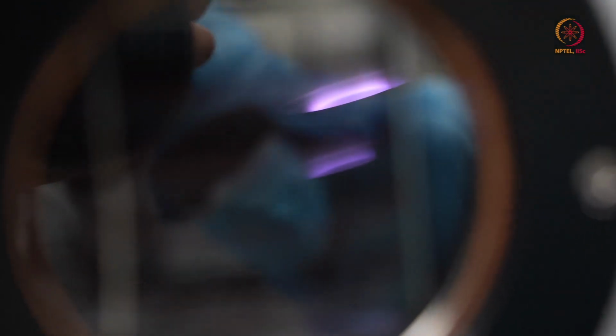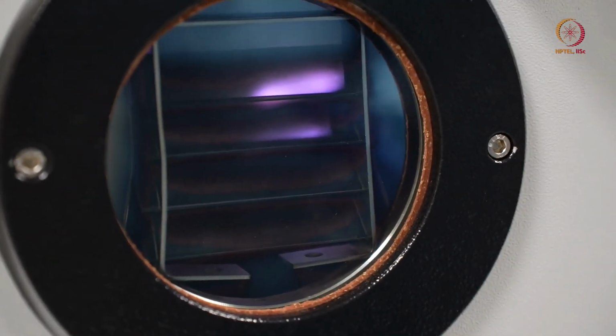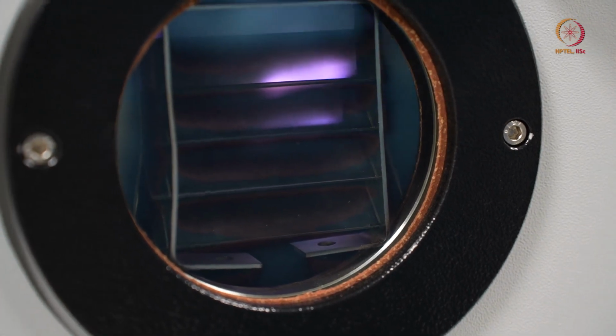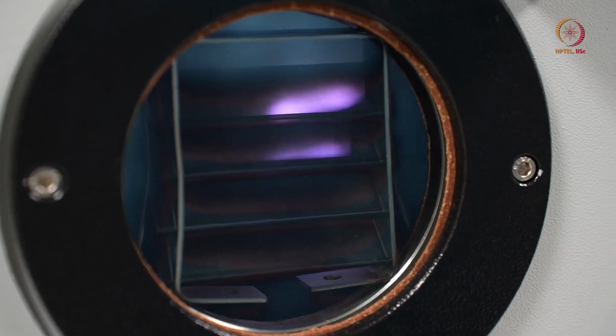So that shutter is basically there, and it is depositing on the back side of the shutter as long as the flow is kind of stable. So it is depositing for some time. So now we are going to open the shutter, so you can see how it is. See now, it is like a beam. You can see the plasma is from the target to the substrate, like that much. Now it is glowing that much, that you can see from here.